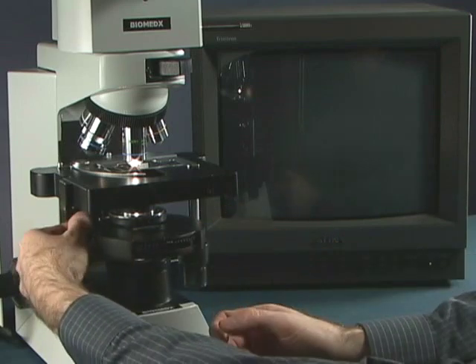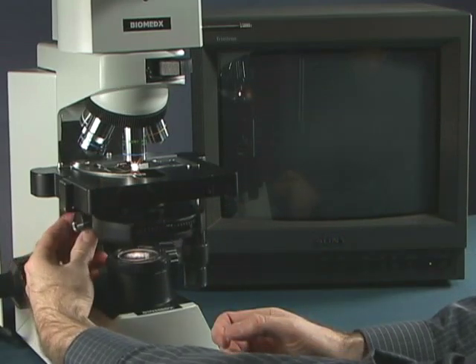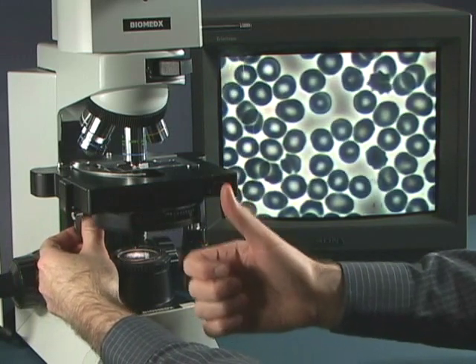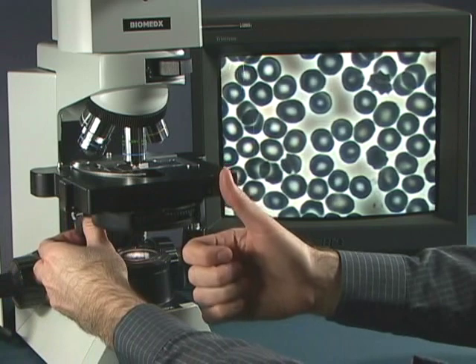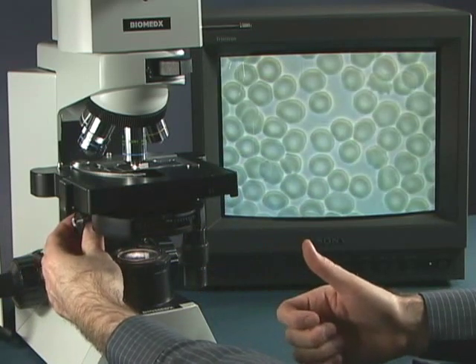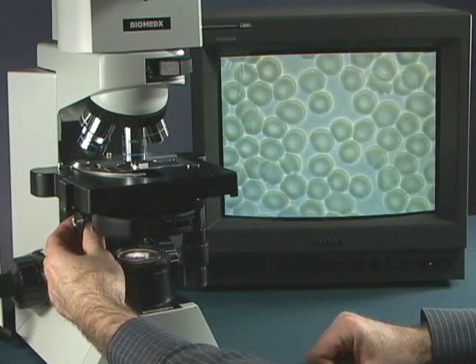The set screw tightened, and then rotated all the way into position. If it's not rotated up all the way into position, you might start getting an image that looks like this.